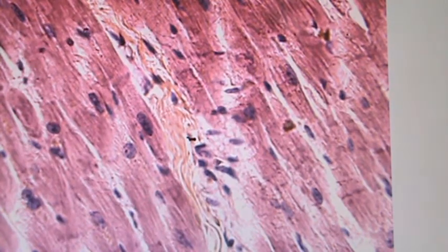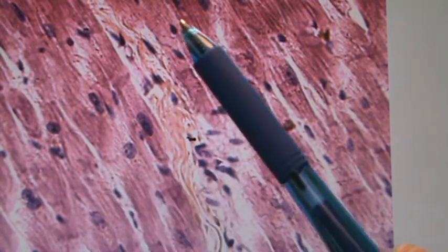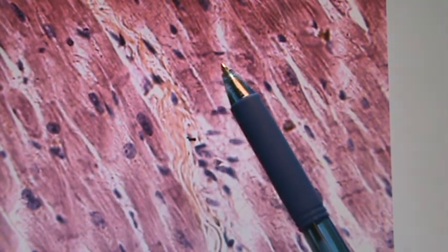All right. Oh, now we got some muscle. So let's see what we got here. With the muscle, you got to look closely, and I got to show you something to look for in this particular kind. If you look right along here, there are these very interesting looking lines that form. Let me zoom in again, see if I can get a better zoom on this slide. This was a slide that was hard to get.